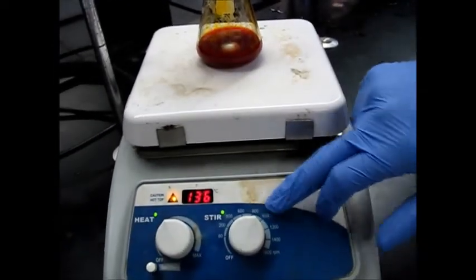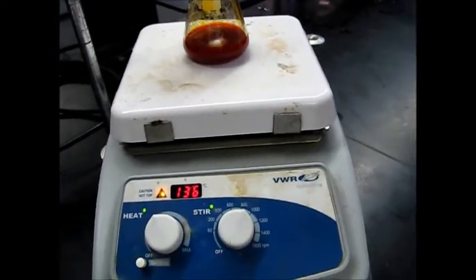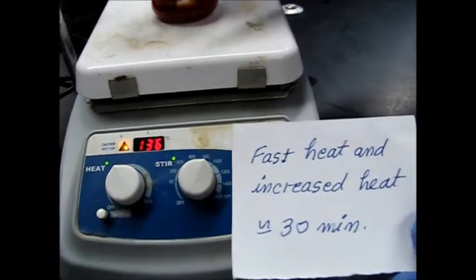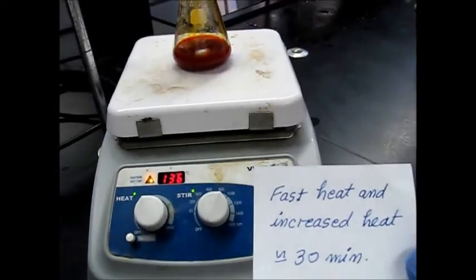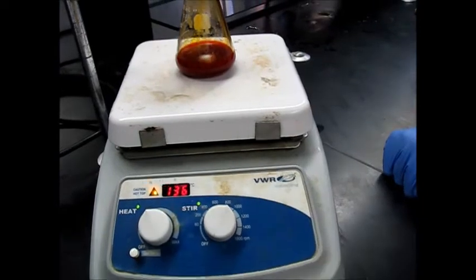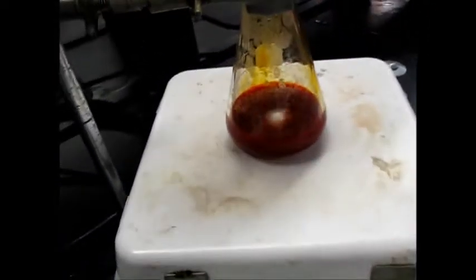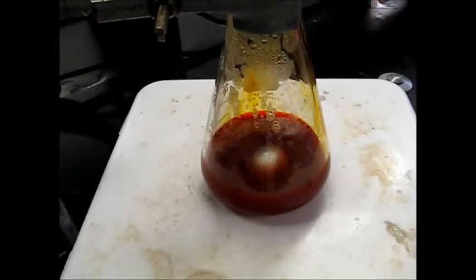And really fast stirring. The faster the stirring, I can see we are at like 900 RPMs. The faster stirring really kind of helps get this solid dissolved. So we probably have another maybe five or ten minutes before it's fully dissolved, and we can continue with the recrystallization.